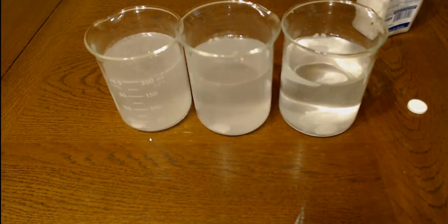Interesting thing, why the tablet takes so long is it's got to eat the outside, and then it kind of works its way in, eats more and more, and so that's why it gets smaller and smaller. If you ground it up and put it in, one would react very quickly, the others less quickly, but it would be over very quickly then. So, yeah, it's getting pushed around there. Let's give it just a hair longer. I'm going to pause the video one more time.